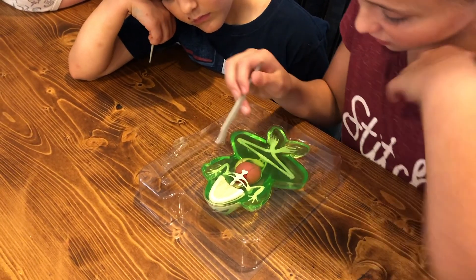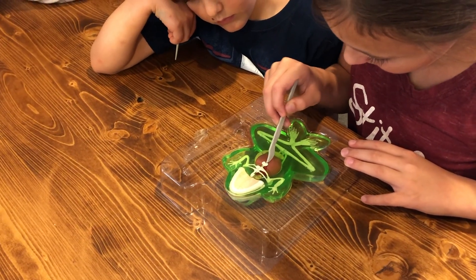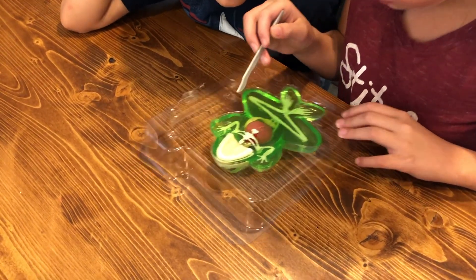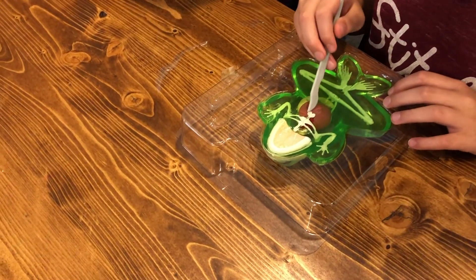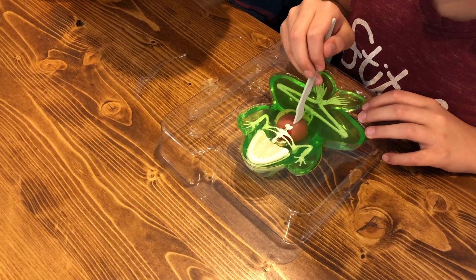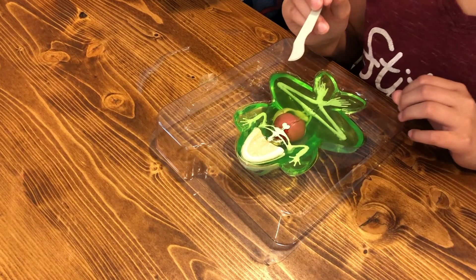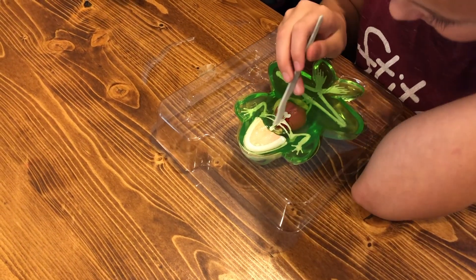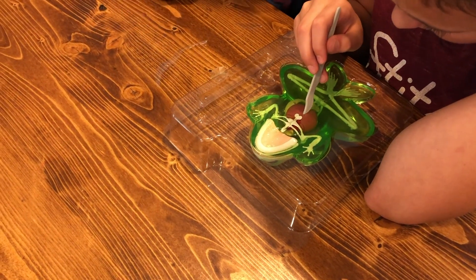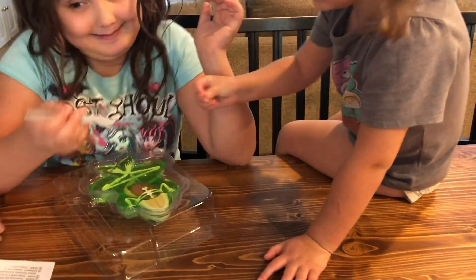Right down the middle? Start under its mouth, under that pink thing, and then you have to cut through. There you go — it's kind of easy. How much do I cut through? How far? All the way to where the feet start. I didn't cut very deep, I'm trying to feel it. This is the best day of all! It's so slimy.